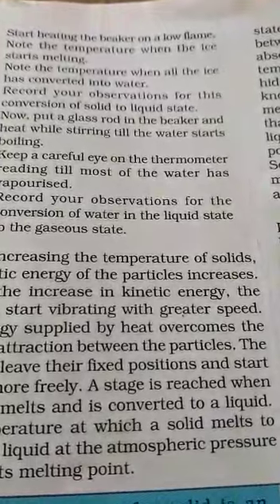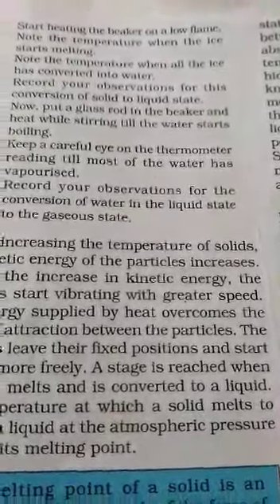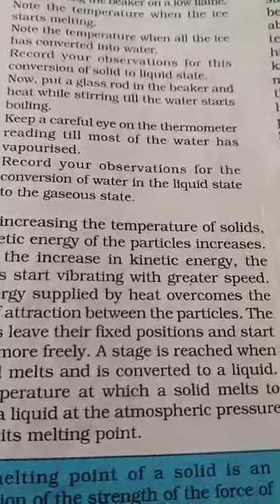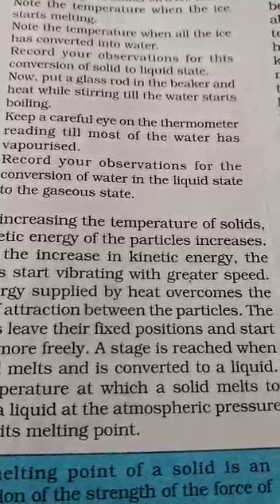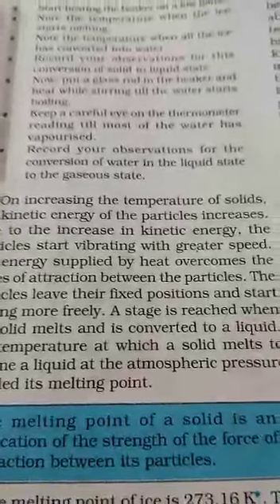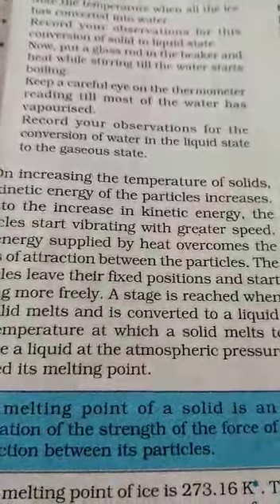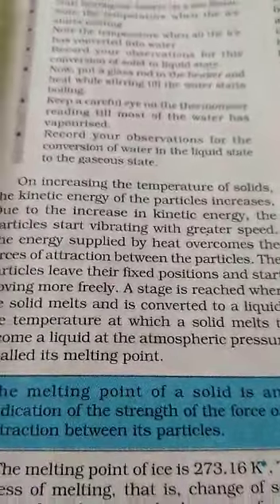Heat the beaker while stirring with the glass rod until the water starts boiling. Keep a careful eye on the thermometer — as heating increases, the temperature keeps rising. Record your observation for the conversion of liquid state to gaseous state — from liquid to gas.